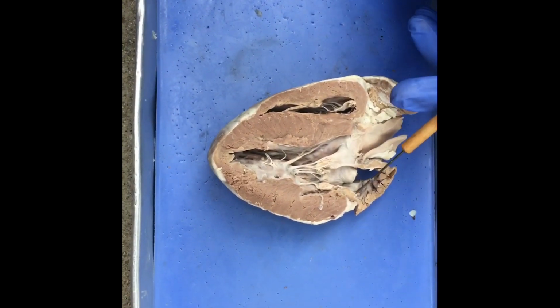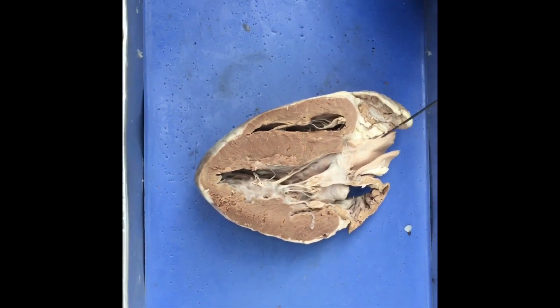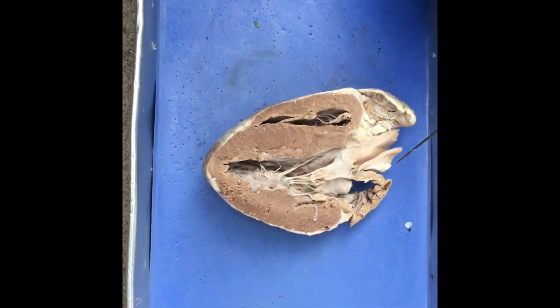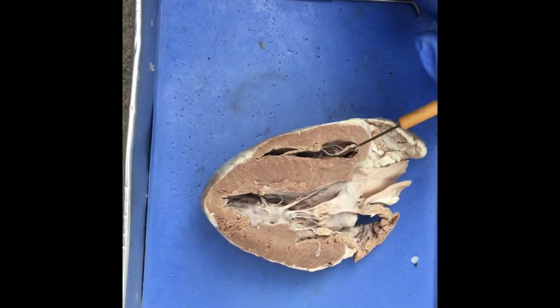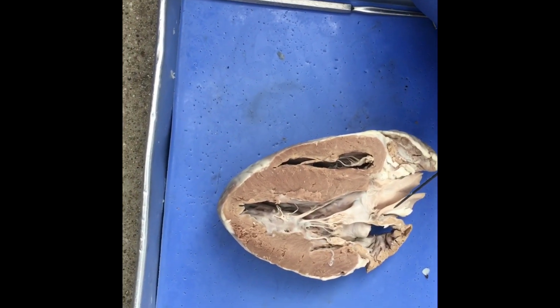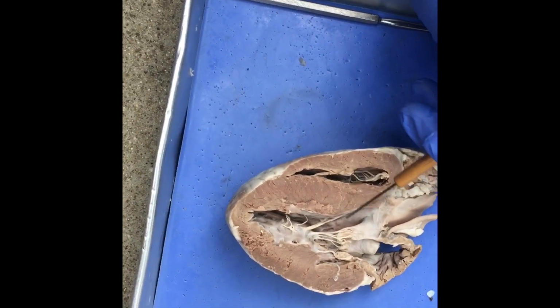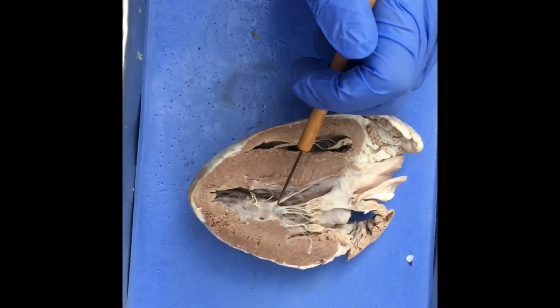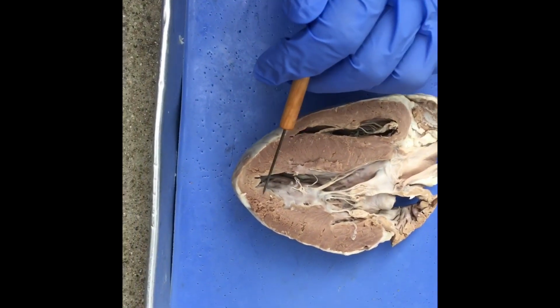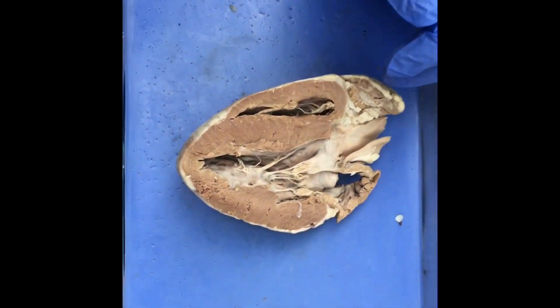Then, after that, the blood gets transported to the left atrium, where now it's actually oxygenated blood provided by the lungs. Then the oxygenated blood leaves the left atrium and enters the mitral valve into the left ventricle. The last step is that the left ventricle carries this oxygenated blood to the aortic valve, which carries the blood to the aorta and transports it to the rest of the body.